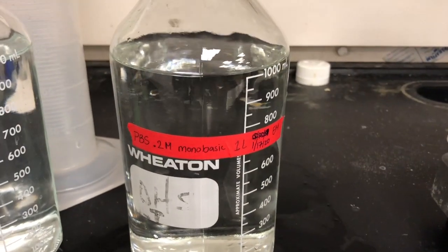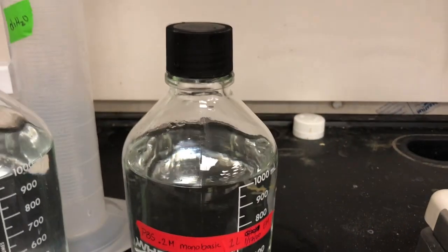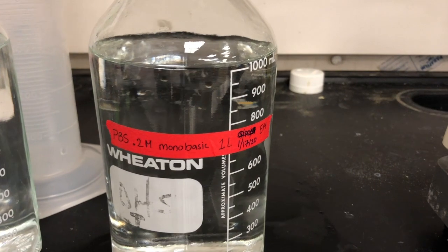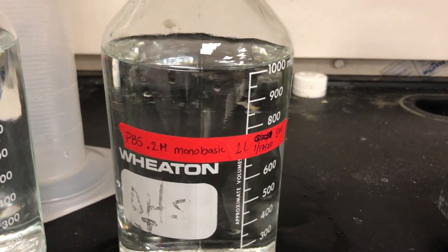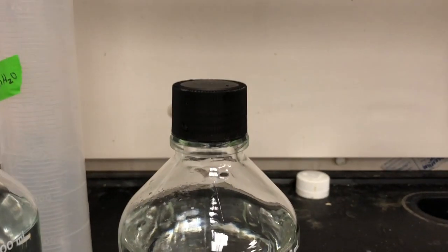Once you QS to a thousand milliliters in the graduated cylinder, you can put it in a storage glassware. Make sure to label it as always: the name, the concentration, your name, the date, and make sure to parafilm the lid before putting it in the fridge.